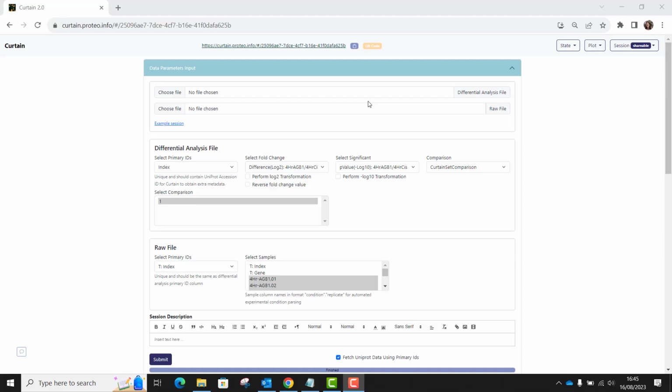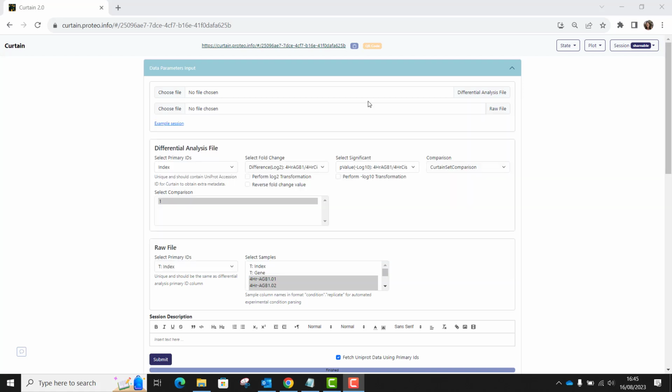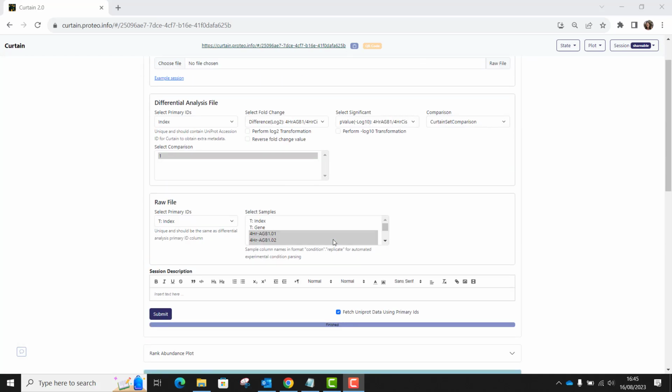Hello again, Curtain users. This is just going to be quite a short video in which I show you how to use Curtain to evaluate the quality of your proteomics data. We'll start from the point at which you have either uploaded your own data in Curtain and clicked submit, or from the point where you have clicked on a link. In either case, this interface is what should appear, with the volcano plot but no protein selected.